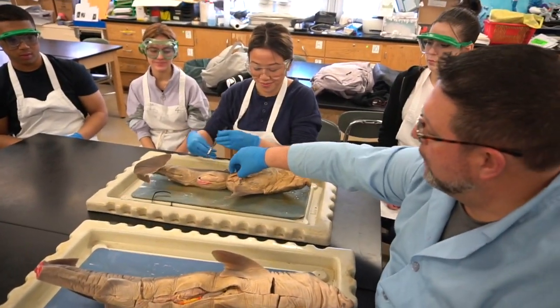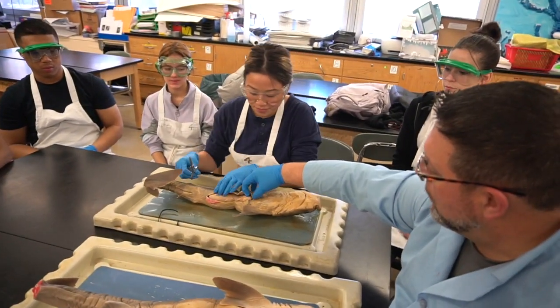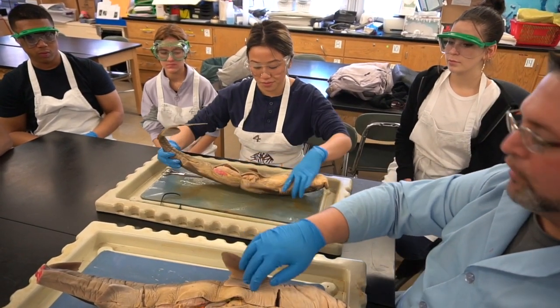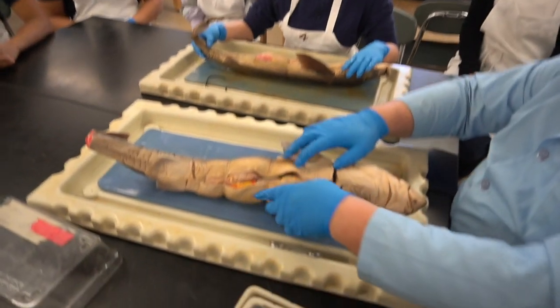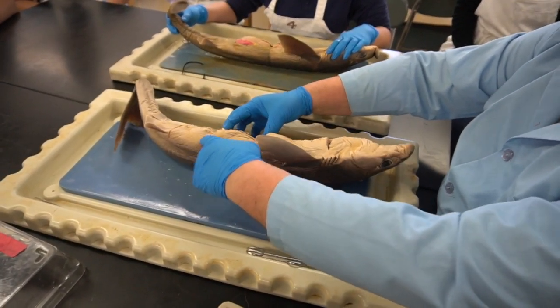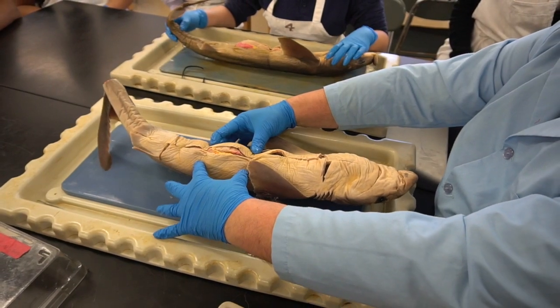Okay. Now in the pre-cut, you can see that it's only about the middle 1/3 of the animal that is open. So let's shift attention here so you can take a look at how this is going to be furthered. All right, you can see here the evidence that this was gripped by two zip ties.